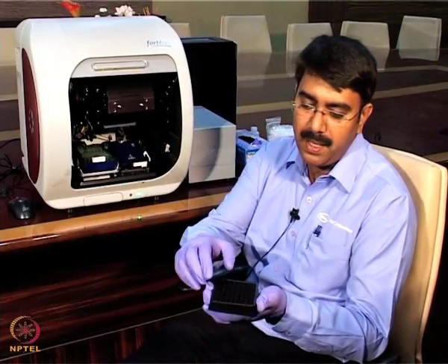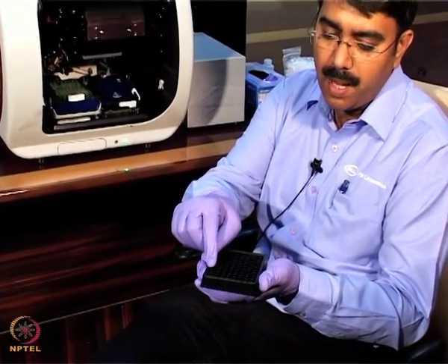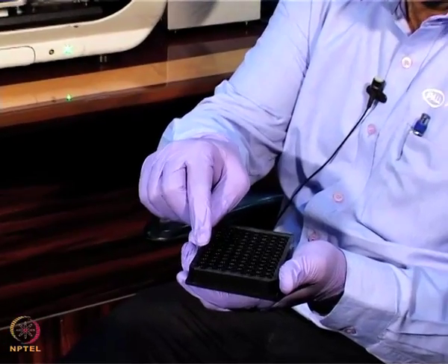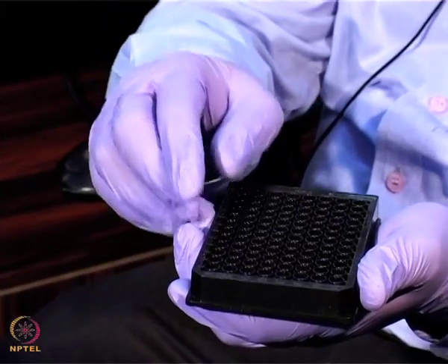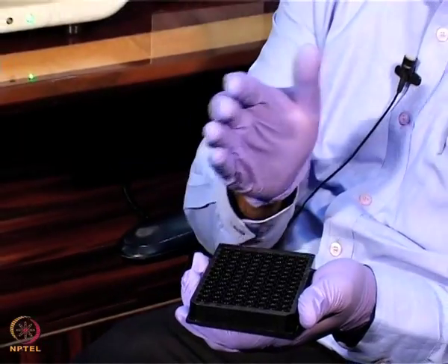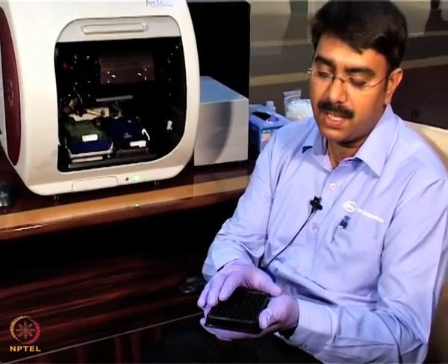This is the plate map here. This is the buffer, the first column, and the second column I am going to put the 10 microgram per ml concentration of a biotinylated protein A, and the third column I am going to put buffer. It will be useful for the unbound biotinylated protein A to get washed off here, and also this well I am going to use for the dissociation purpose.